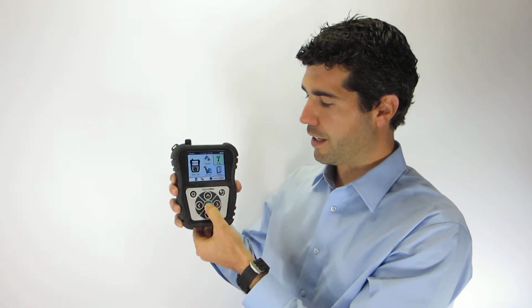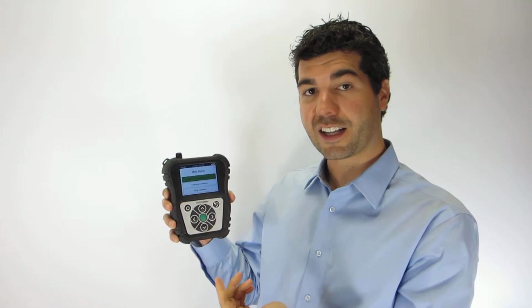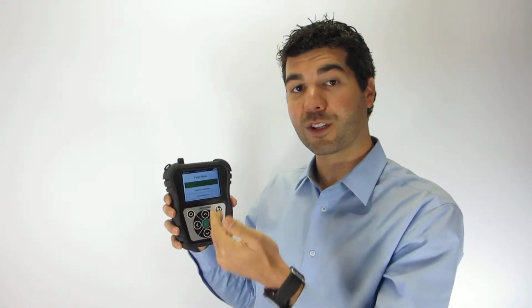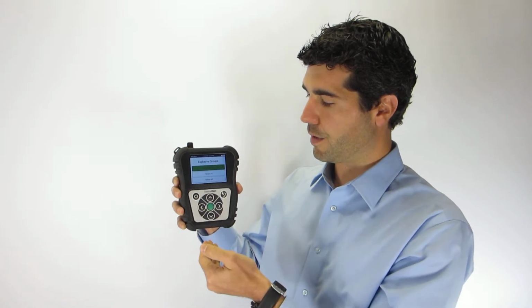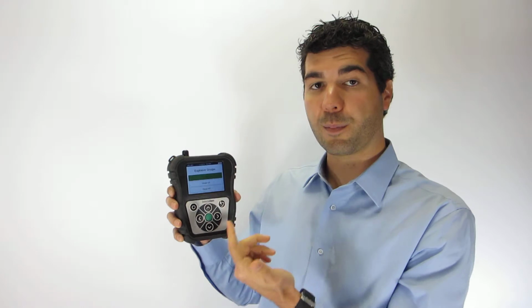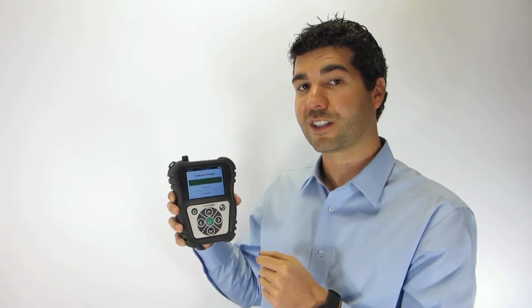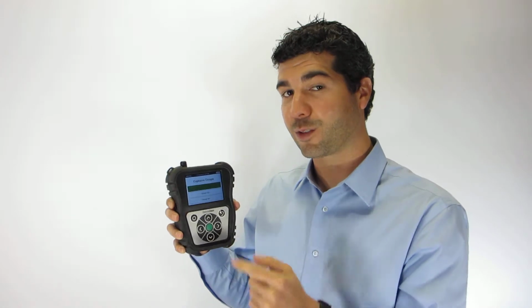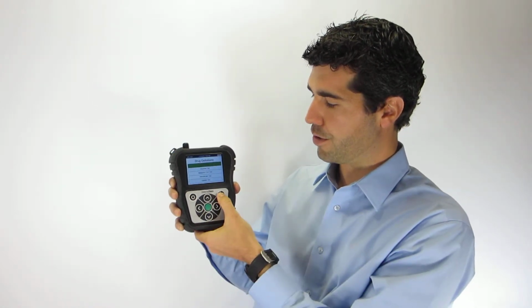The menu to the right is the help menu. This menu allows you to go into a quick start guide, again showing you how to use the Seeker, although it is quite simple if you follow the on-screen prompts. The next one is explosive definitions. Again, explosive definitions are listed based upon group 1, 2, 3, 4, and 5. Remember, the Seeker is the only detector on the market that can detect all 5 groups with just one test. And then, of course, drug definitions.